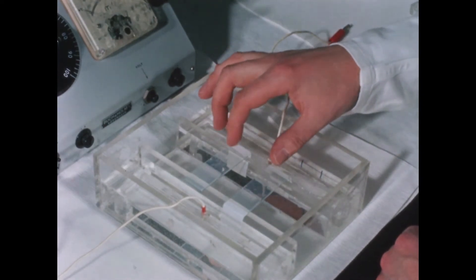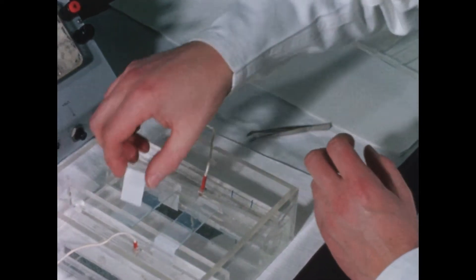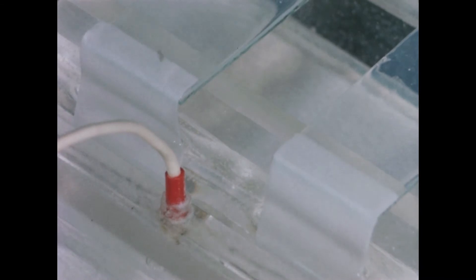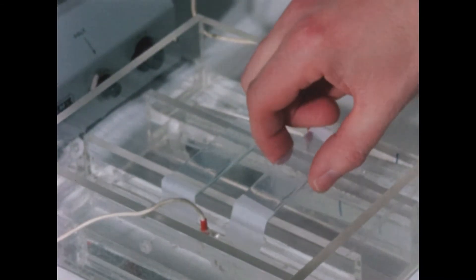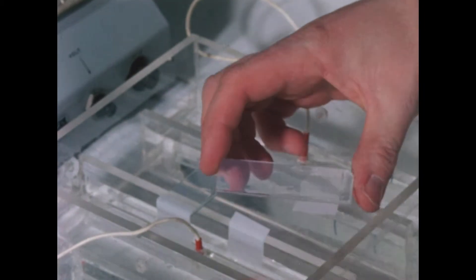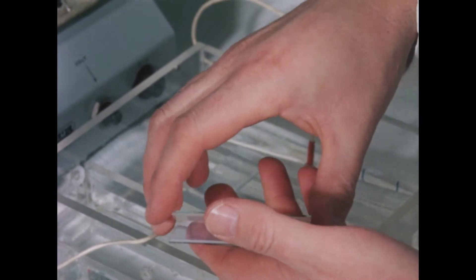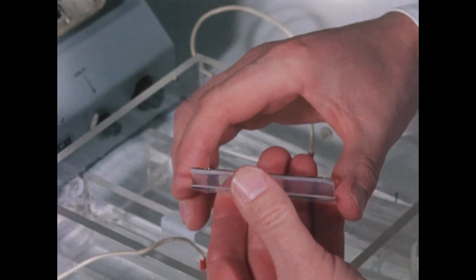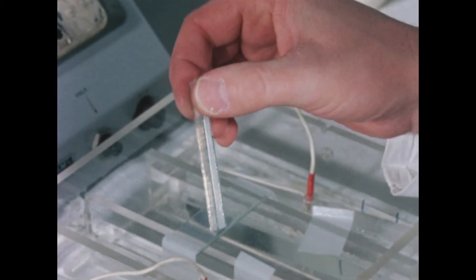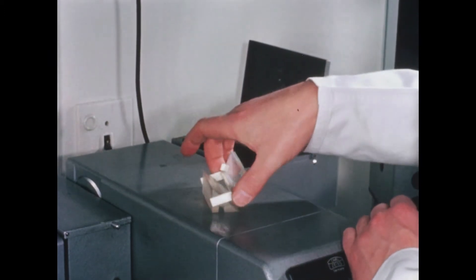After the electrophoresis, the agar plate with the separated enzymes is brought into contact with another agar plate containing the substrate which activates the enzymes. After a suitable incubation period, the position of the enzyme may be located by the change in the substrate concentration. This is done by fluorometric analysis and the localization may then be correlated with the various serum protein fractions shown here after staining of the plate.